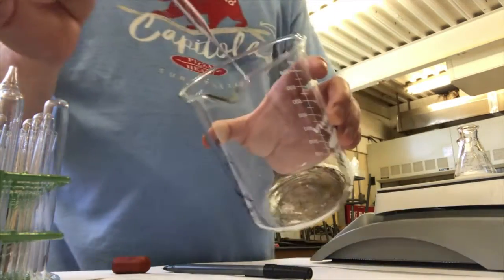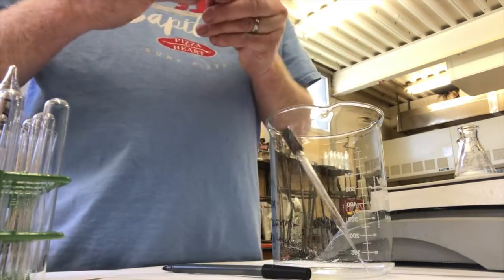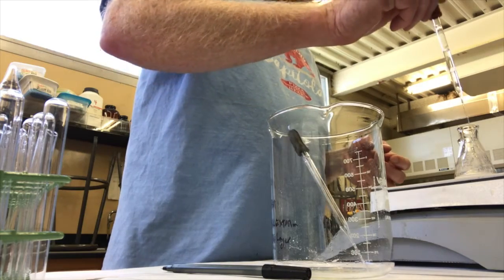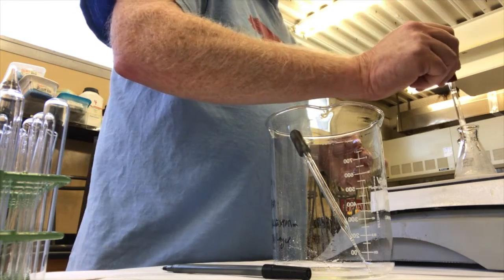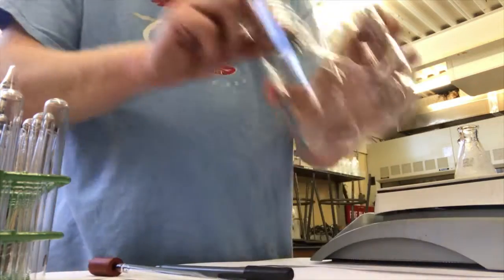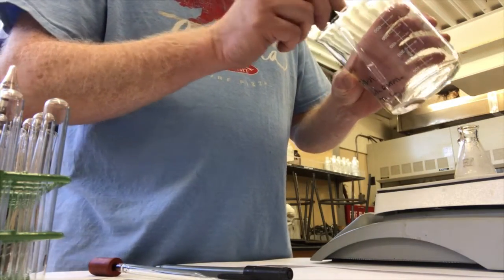And now this pipette is a bit contaminated, right? So I'll use a new one for my crystallization solvent flask, so I keep that clean. Oh, I want to put this over here now. I'm already starting to run out of the methanol. The methanol boils away so quickly. It's okay, I can add more.